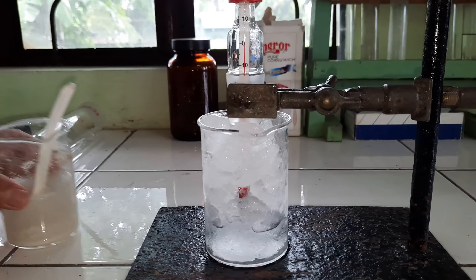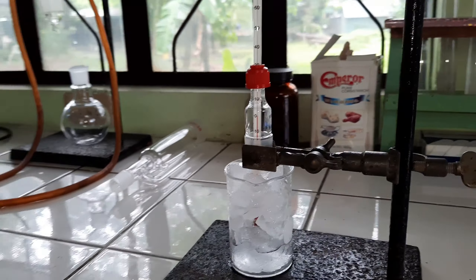Water in the form of ice freezes at 0 degrees Celsius. What will happen if I add a supersaturated solution of sodium chloride into this setup? Now I am preparing the supersaturated solution of sodium chloride. Now I will pour this into this setup.